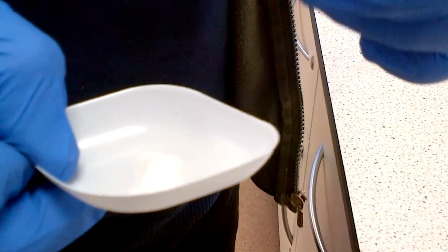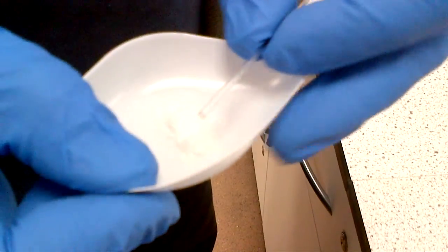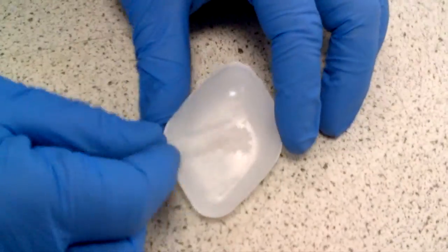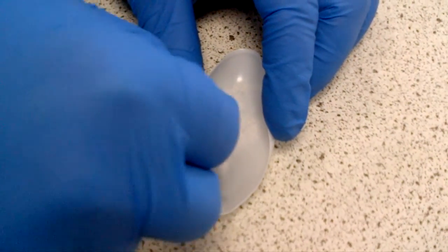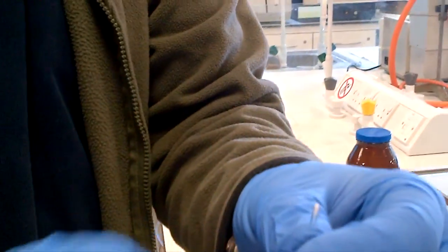So in the open end you need to put the sample in. What's best, in my view, is to get about a few flakes, a few crystals of sample. You press down the open end into the mass of the crystal sample, so you just press down like that, and you can see there is a little bit of sample at the top of the tube. That's a good depth of sample, maybe about one to two millimeters.